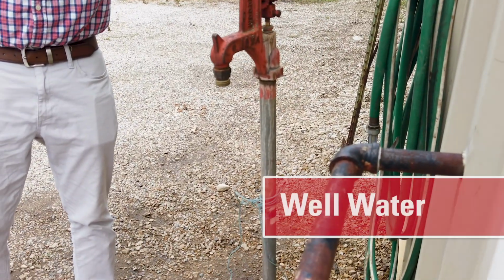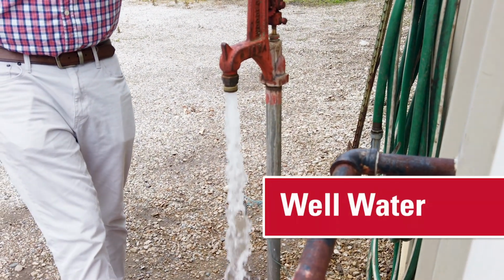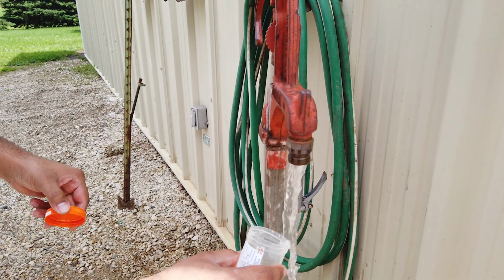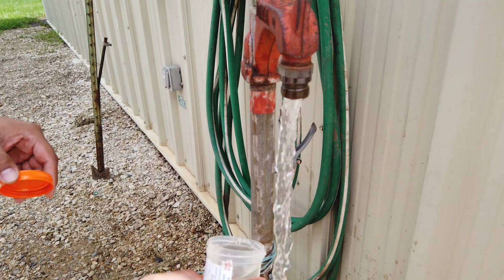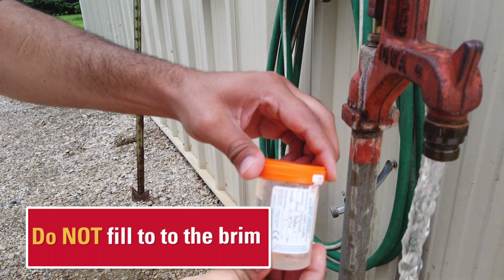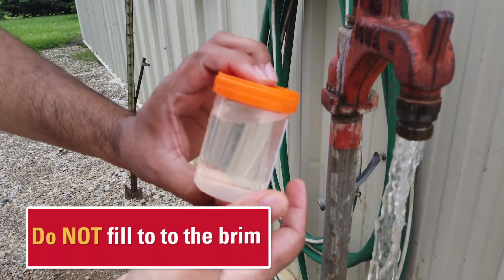For well water, run the pump for a few minutes to make sure the water in the well riser is not sampled. Make sure the sample represents the current well water. While collecting a sample, do not fill the bottle to the brim. Leave head space to allow mixing of the sample before analysis.